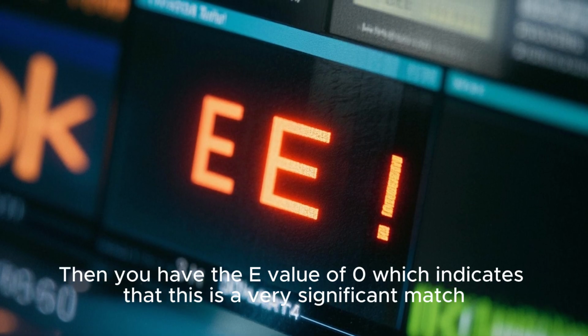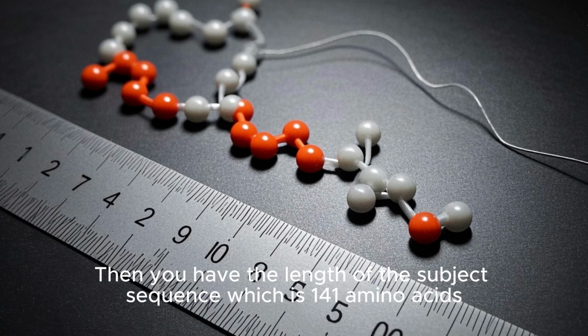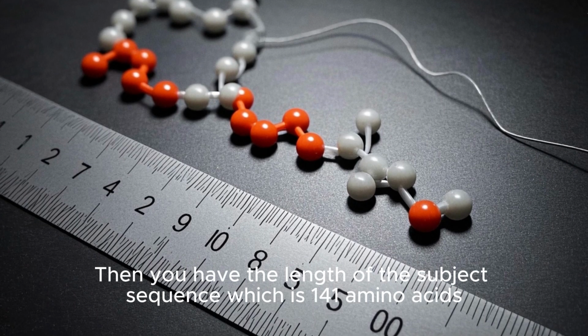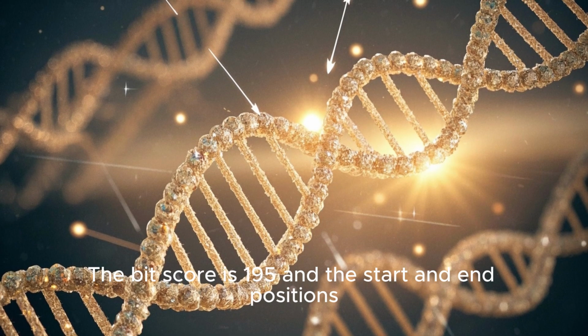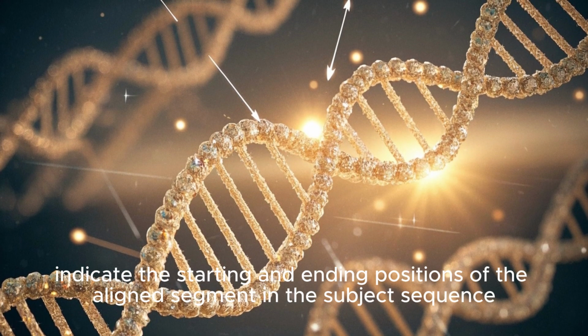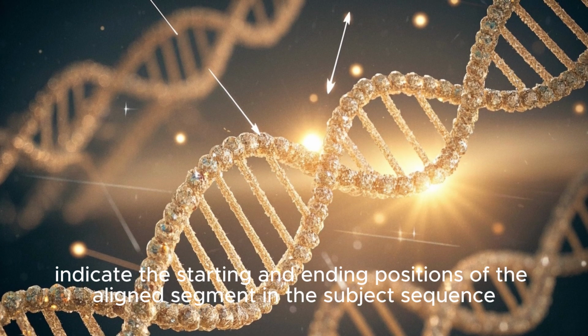Then you have the E value of 0, which indicates that this is a very significant match. Then you have the length of the subject sequence, which is 141 amino acids. The bit score is 195, and the start and end positions indicate the starting and ending positions of the aligned segment in the subject sequence.